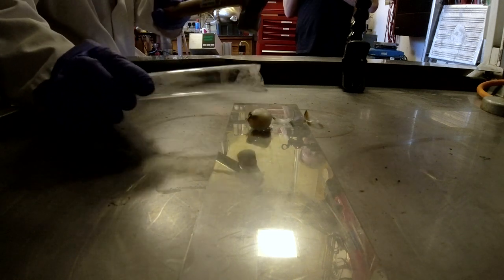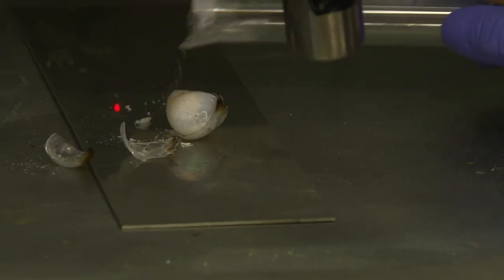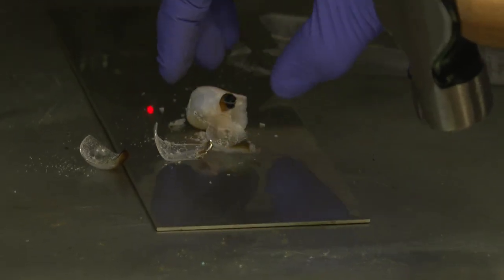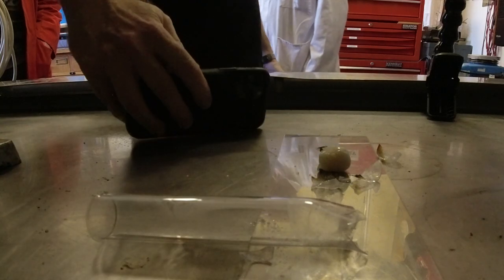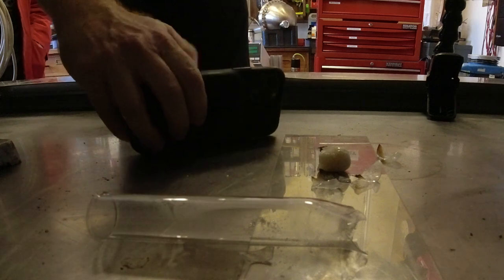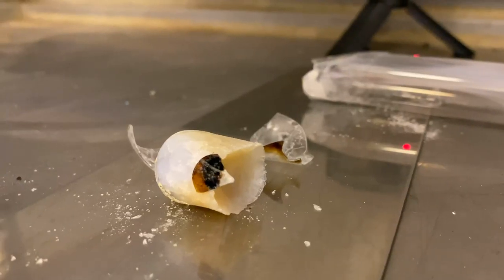And out came the sodium chloride, potassium chloride and sodium mixture. Once it was cooled down, it was obvious that the sodium chloride was slightly blue. So the experiment worked.